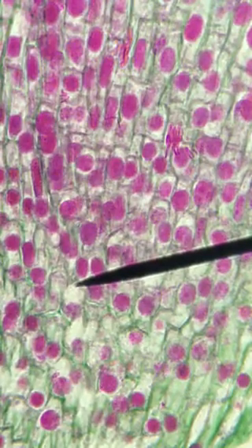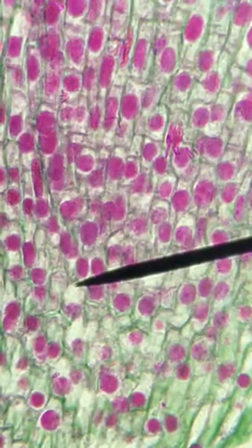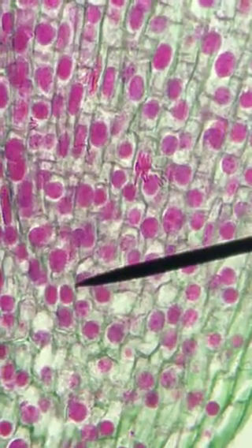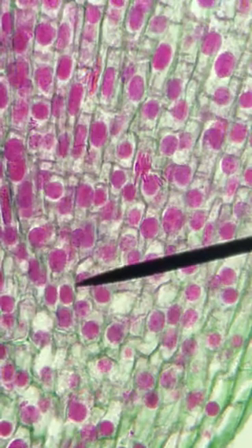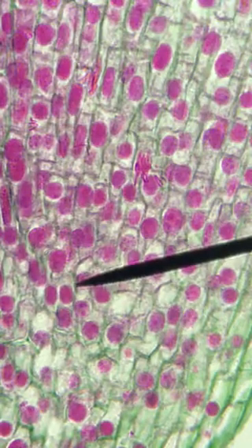So what you want to do is take any particular vertical row, and use the two knobs on the stage. One will move you left and right, and one will move you up and down. The idea here is to move the stage vertically, and you can choose to either count 30 cells as you move vertically, or you can move in chunks, maybe count 7 or 8 cells and then move the stage, count another 7 or 8 cells, and do it that way.